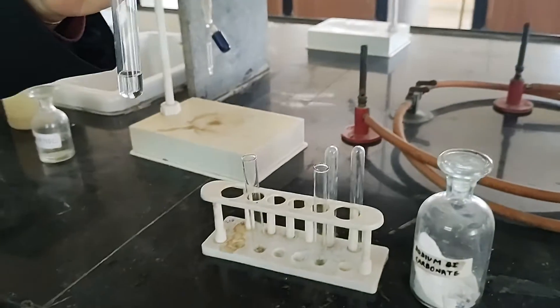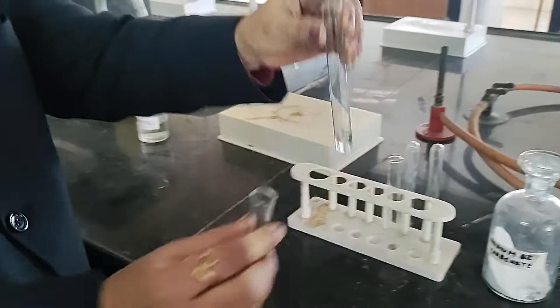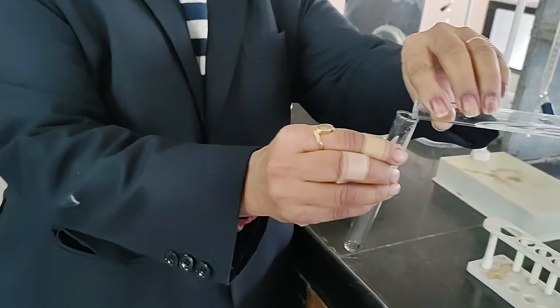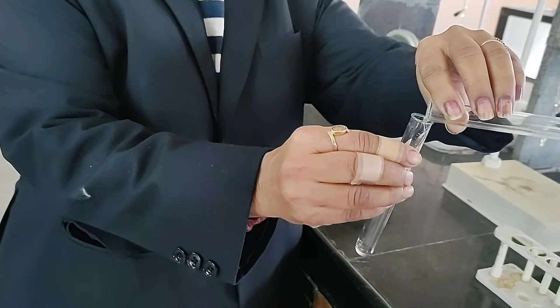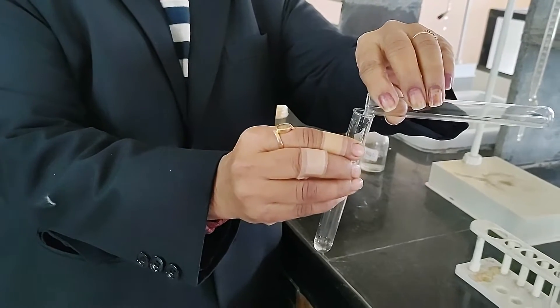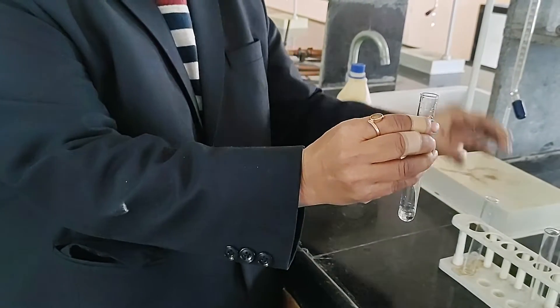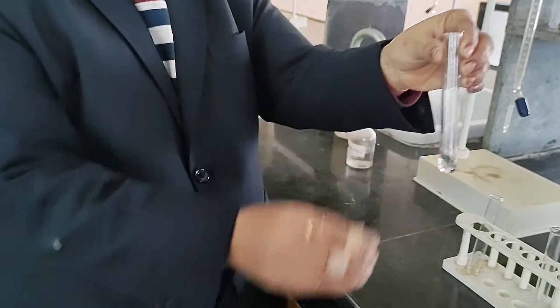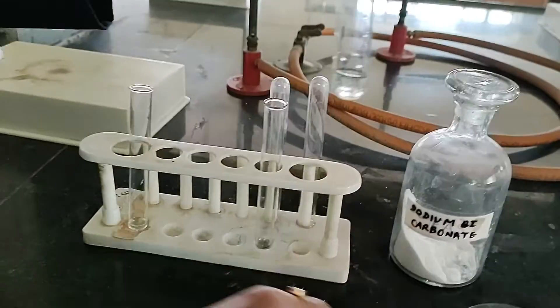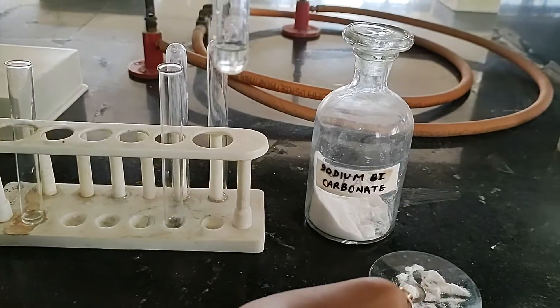Now let's perform the test. Take a small amount of the given organic compound. Now to this organic compound, add a small amount of sodium bicarbonate.